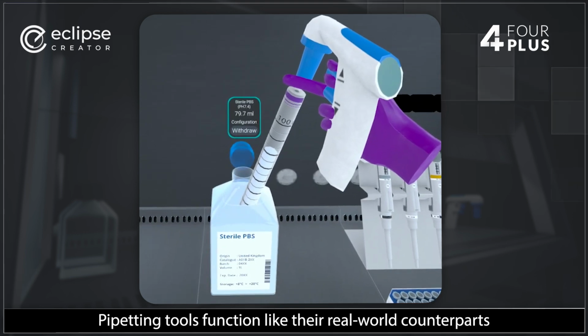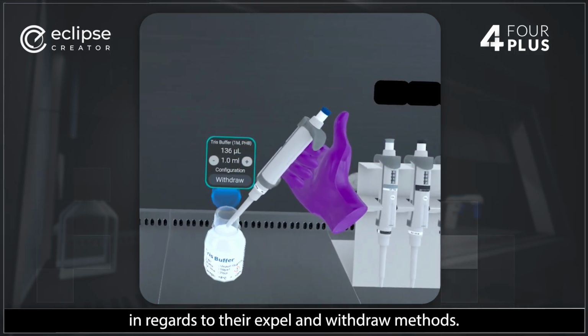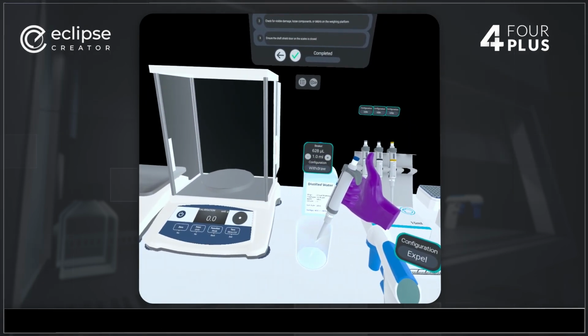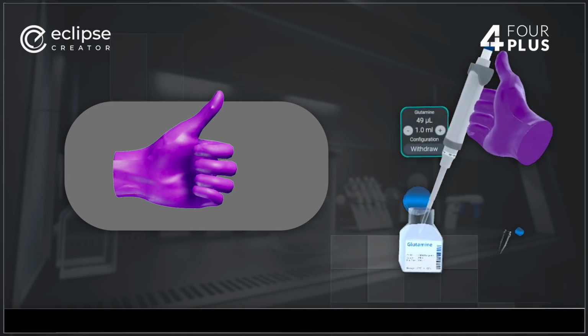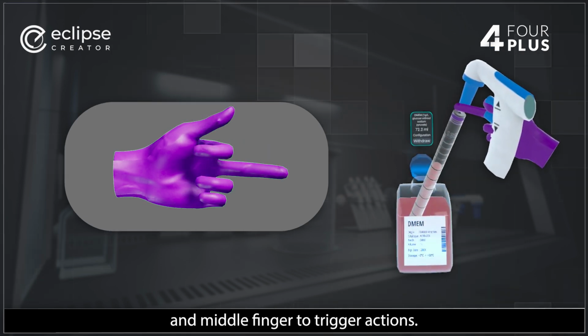Pipetting tools function like their real-world counterparts in regards to their expel and withdraw methods. Micropipetting uses your thumb, and serological pipetting uses both index and middle finger to trigger actions.